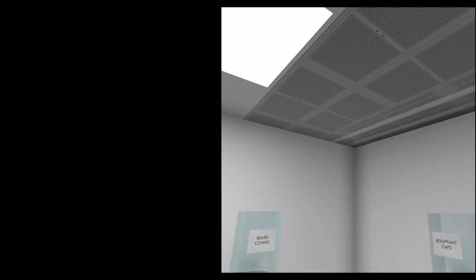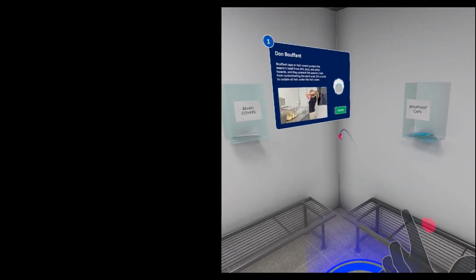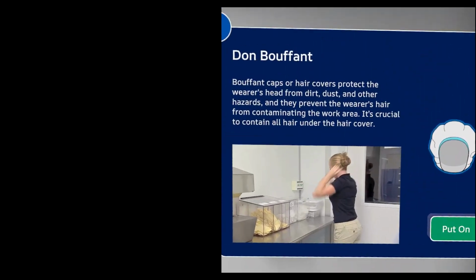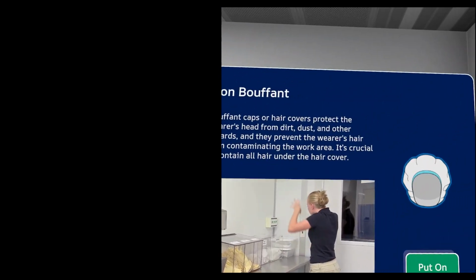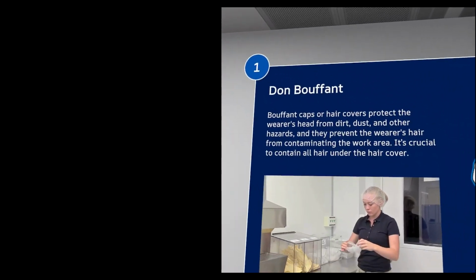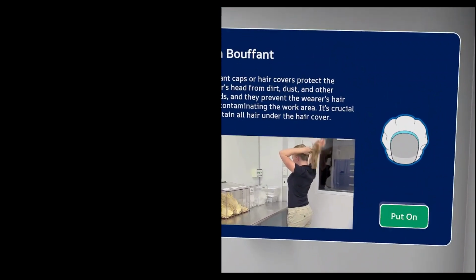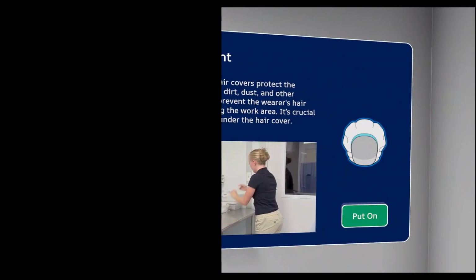Teleport to the footprints at the entrance of the pre-gowning room. Notice how the information panel for the hair cover provides you with some extra information on each piece of PPE. Take the time to read these at each station to refresh what you already know about PPE. Keep note of the order in which you don your PPE. This is important for your learning.